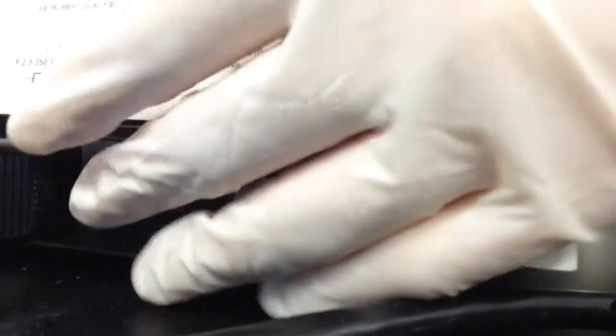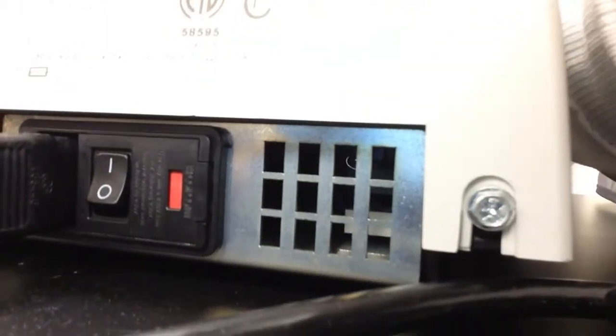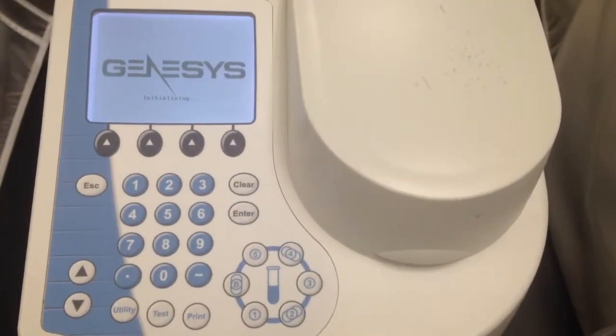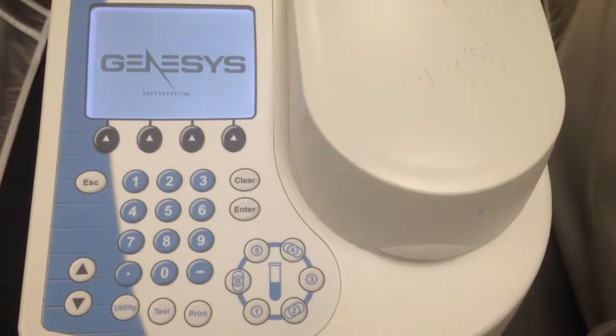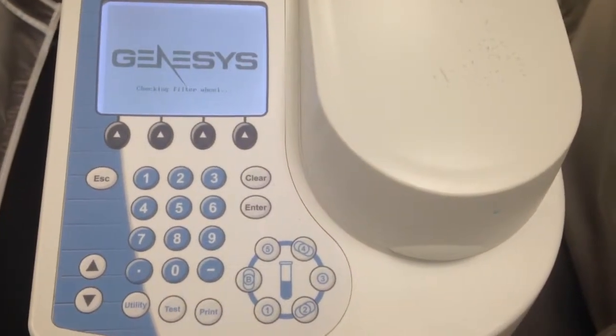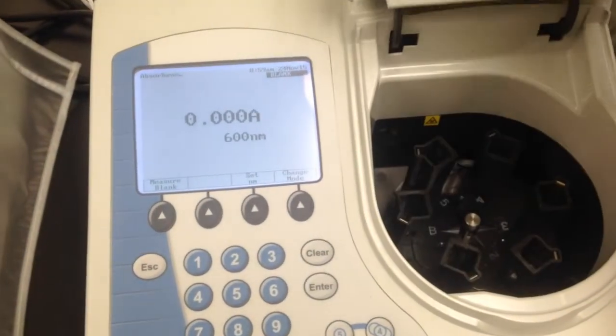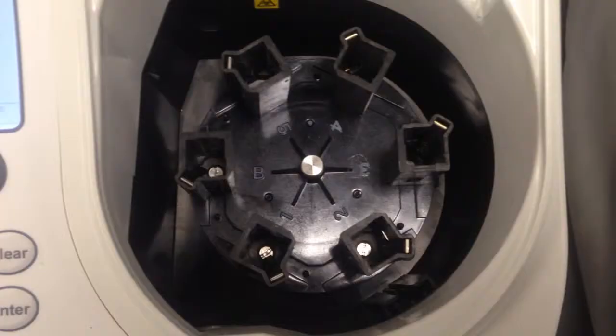Before using, you obviously want to turn on the machine. Doing so will then allow the machine to initialize and recalibrate. Just in case you were curious, this is what the cuvette slots look like.